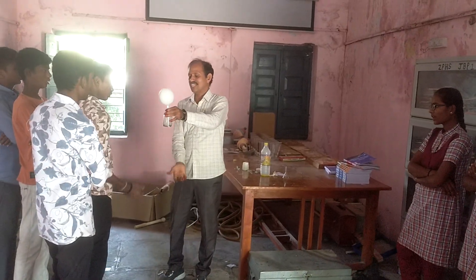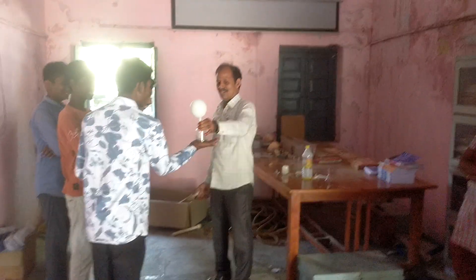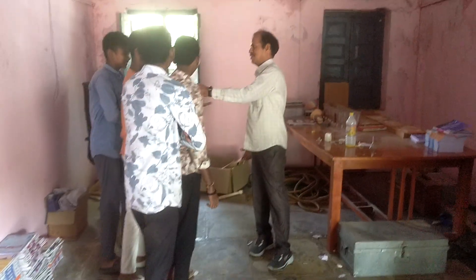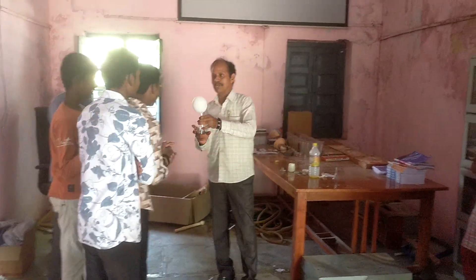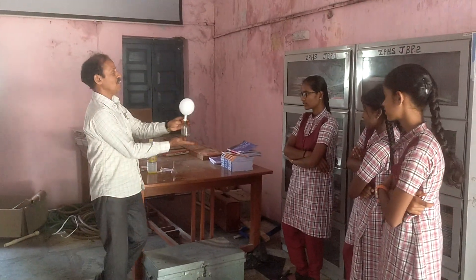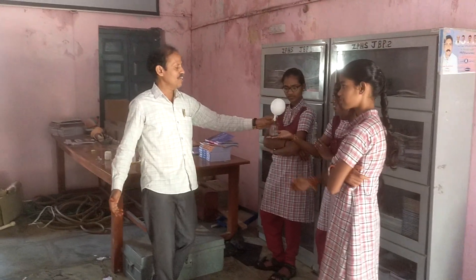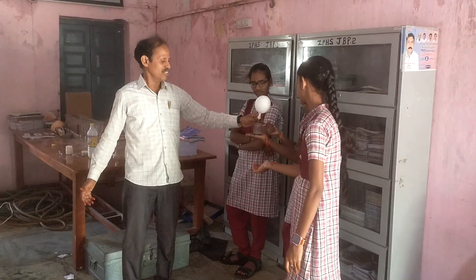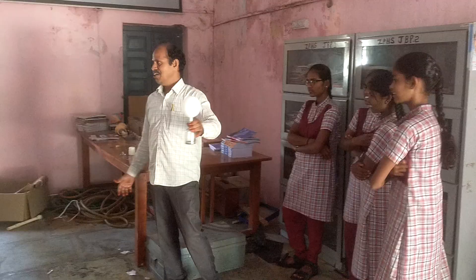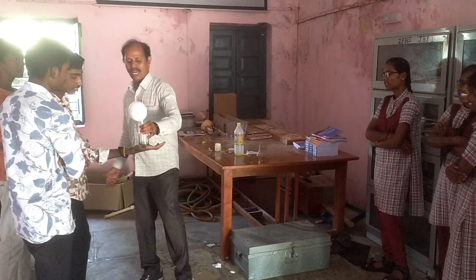Now you can touch this reagent body. Is it exothermic or endothermic? Heat is liberated. If heat is liberated, the type of chemical reaction is an exothermic reaction.